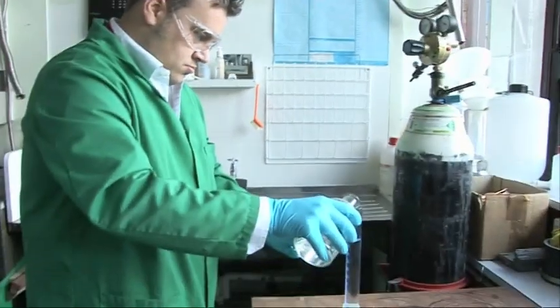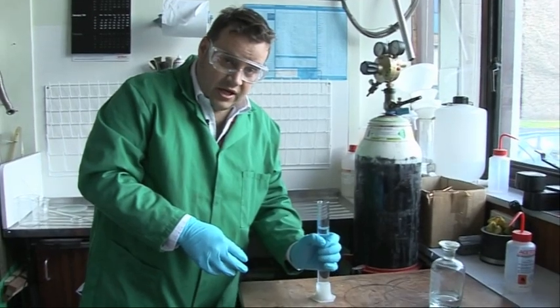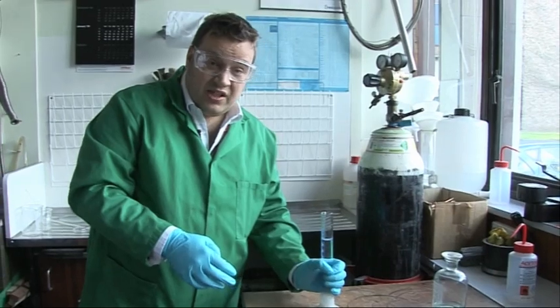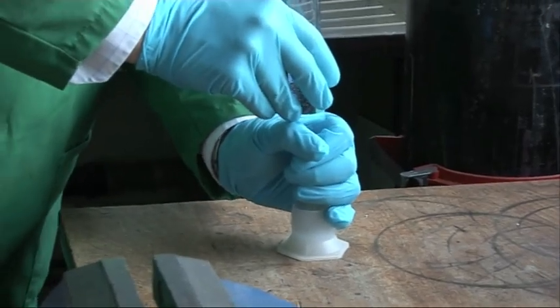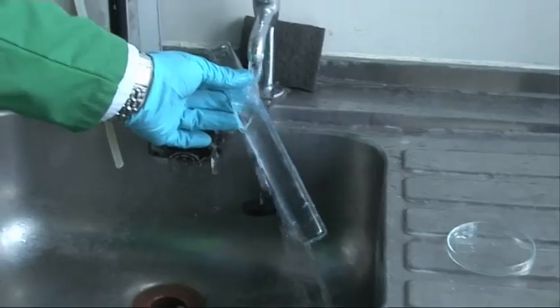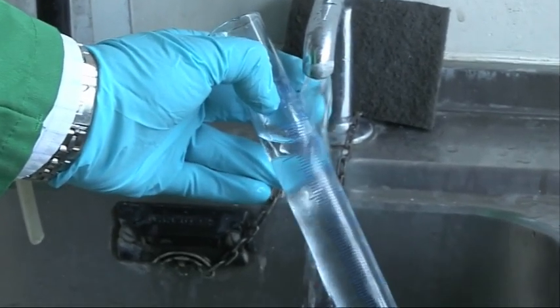The water was room temperature. But if I hold the measuring cylinder here, it's actually very hot. It's nearly 40, 50, 60 degrees C. So now before we do our experiment, we've got to allow it to cool. And we do that by simply running cold water outside the tube.